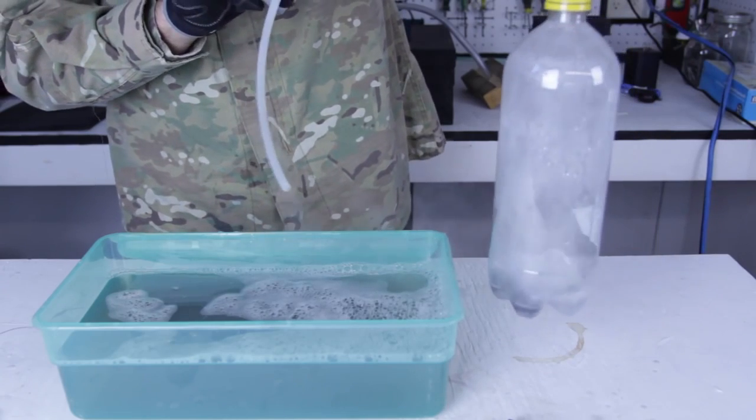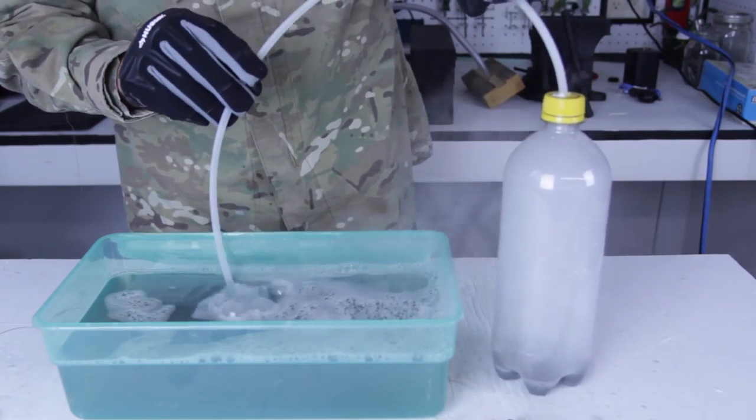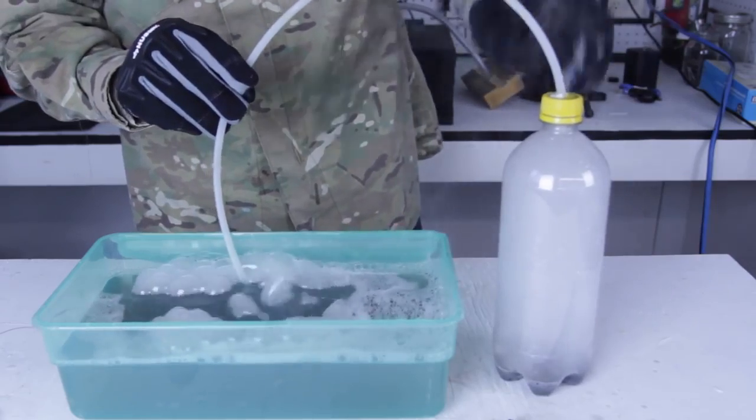As you can see, it's creating fumes, they're going to go up the tube. I'm going to make bunch of bubbles.